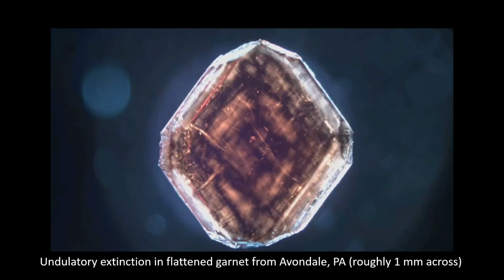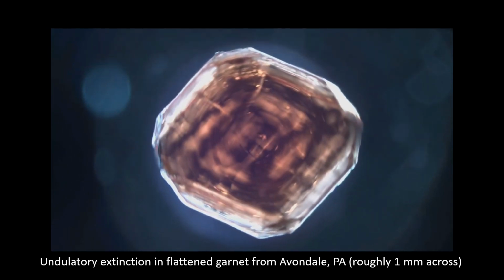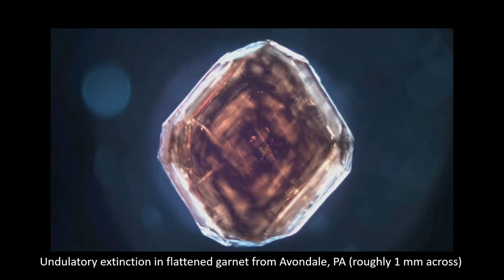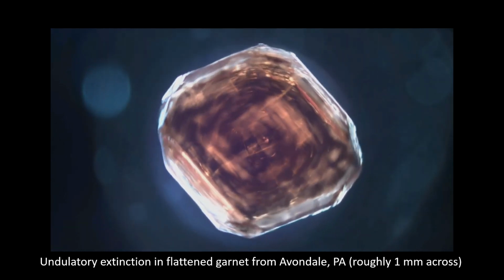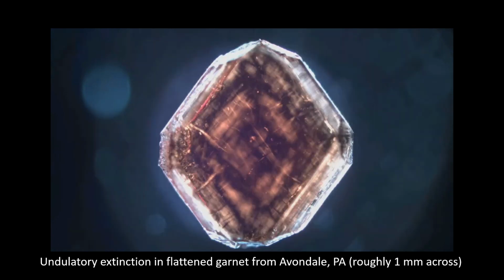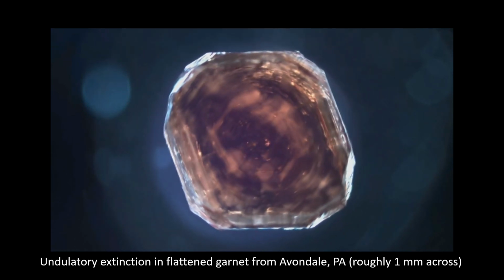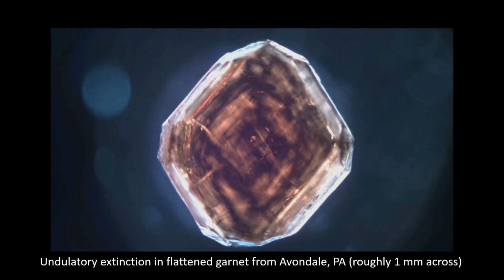So as far as interference figures, the garnet that we looked at didn't have any coherent figures where we were actually able to observe isogyres. However, the optical anomalies that we observed in both the gahnites and the garnets, particularly this undulatory extinction, indicate that the anomalies are stress-induced. So while analysis with single crystal X-ray diffraction still placed the crystals in the isometric class, the optical characteristics are much more sensitive to small variations in symmetry and exhibit this through anomalies.